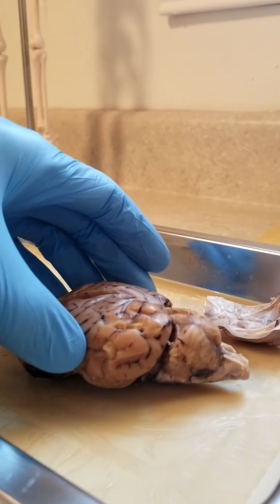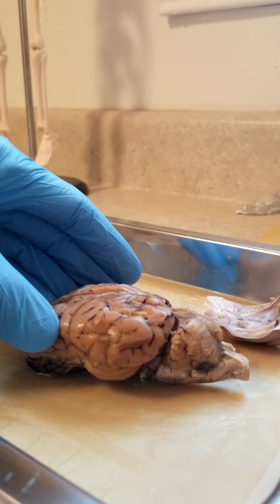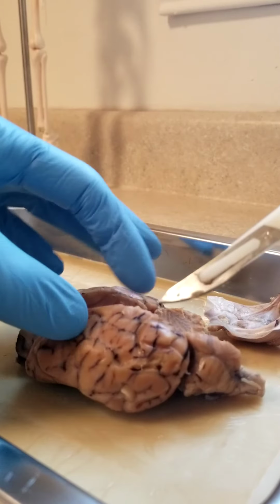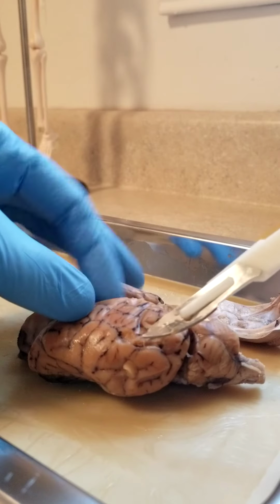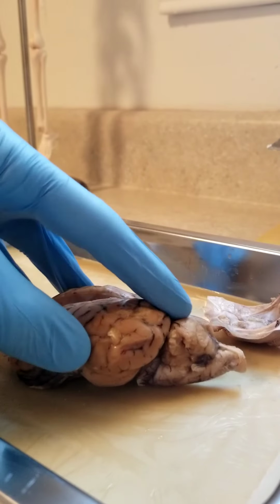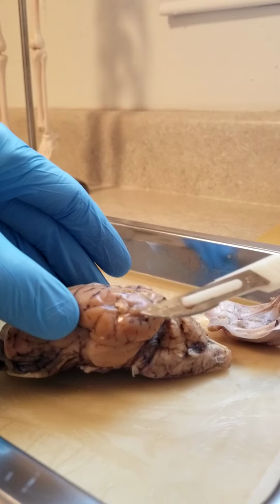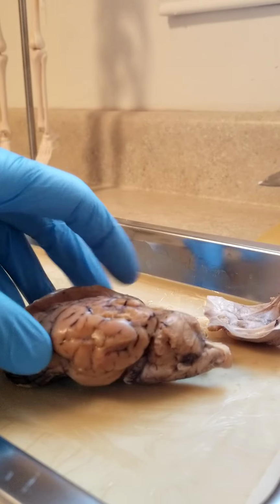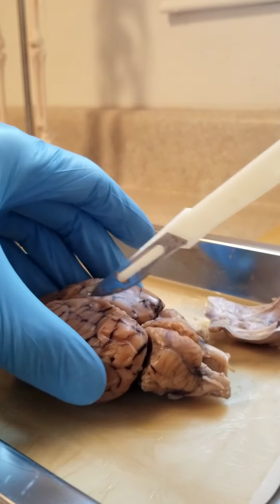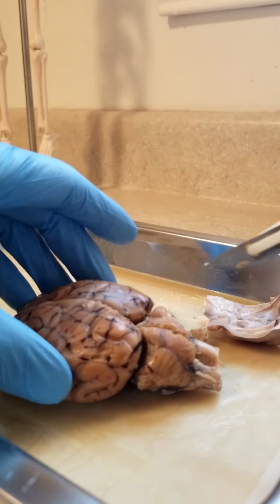When you go to the cerebrum, that's right here on the side of the brain. And if you go to your sulcus or your sulci, that is more or less the valley here, the dark or the deep parts on the brain there. And the gyrus or the gyri would be your side folds, so kind of like a raised bump area there. Your longitudinal cerebral fissure was right down the middle there. That's where we made the cut and the incision on the brain there.